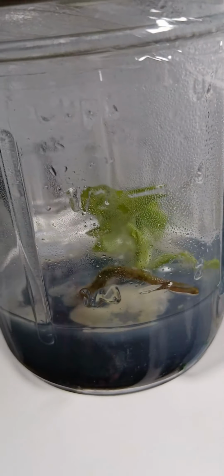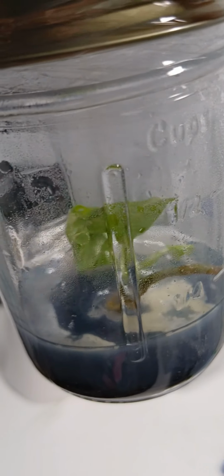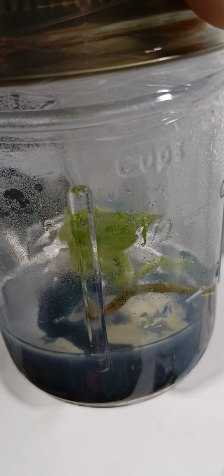which is generally nutrient free. So you wouldn't see any of this in the media they ship it in, but you will see it once you feed it some sugar and nutrients.